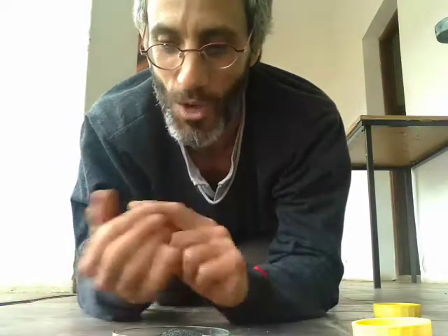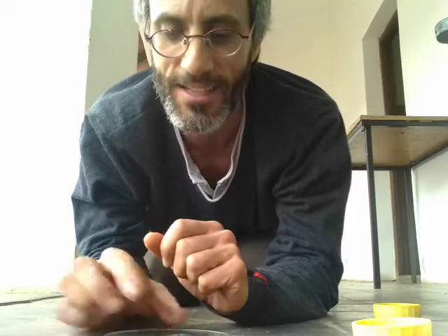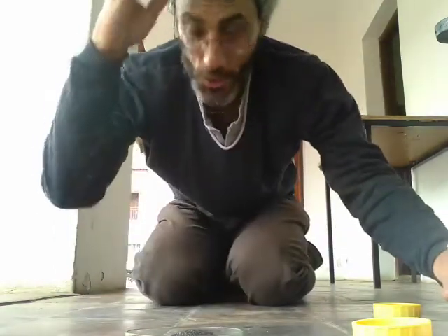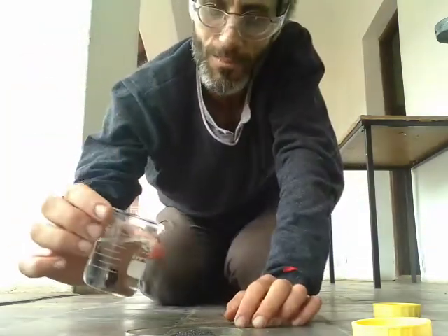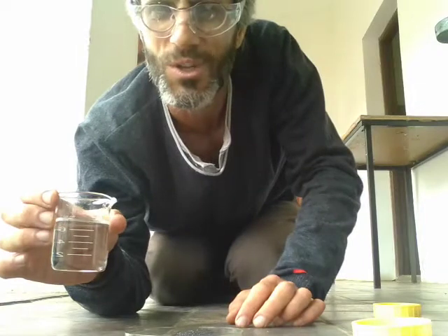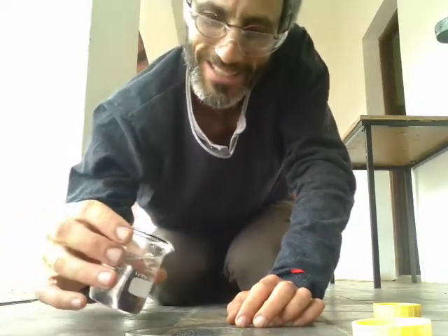And sometimes we can use heat, like we did just now with the magnesium. We heated up the magnesium and it reacted with oxygen. And sometimes you can add a catalyst. And this is what we're going to do now, a catalyst. A catalyst is something that speeds up the reaction. So we'll do that by adding a little bit of water, just simple water. Now, it doesn't always work. Sometimes I put too much water. So if it doesn't work, don't worry, I'll show it to you again.